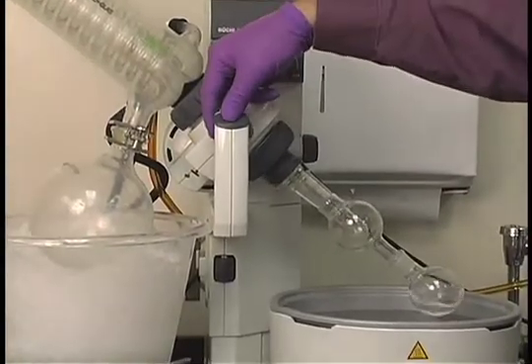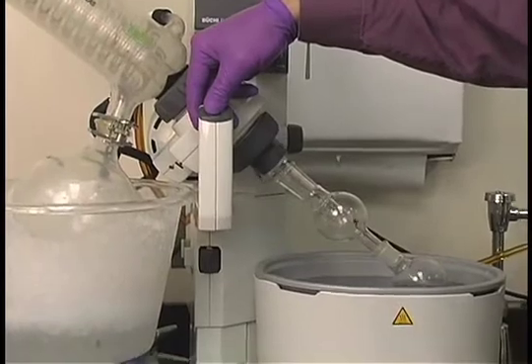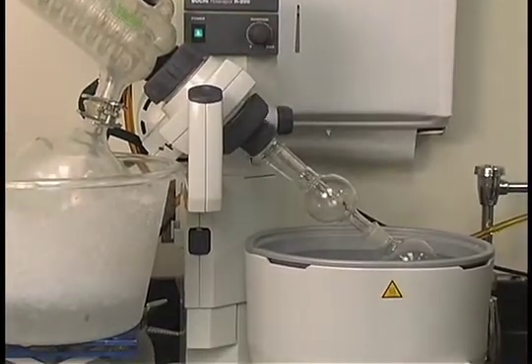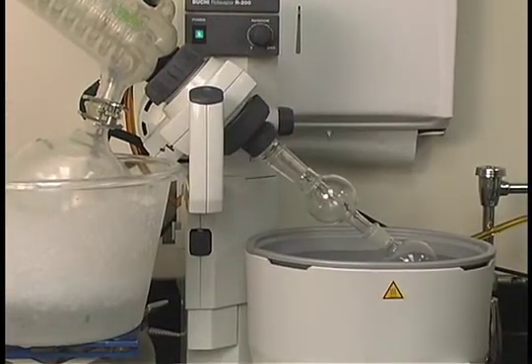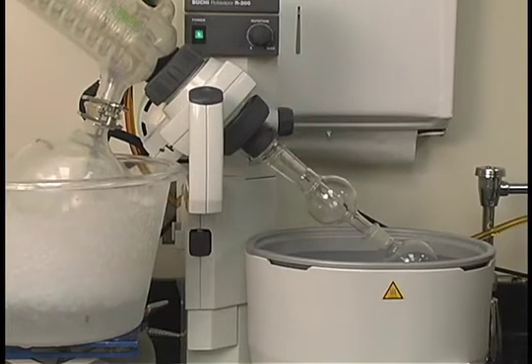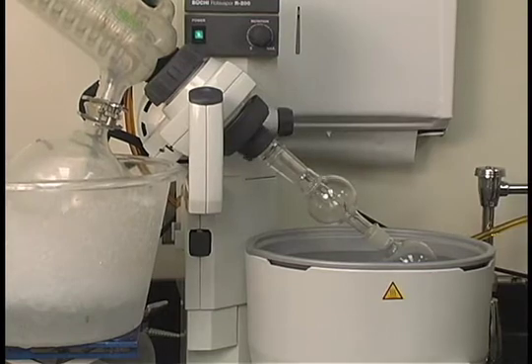And then lower this into the bath and continue until the solvent is totally removed from the solid. This usually takes somewhere between three to five minutes.